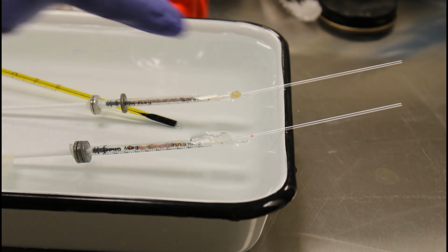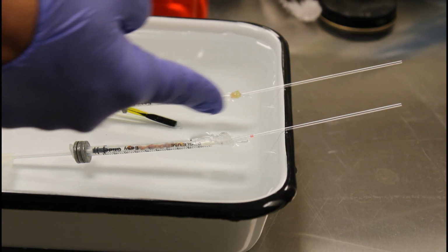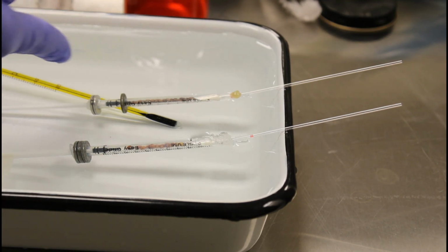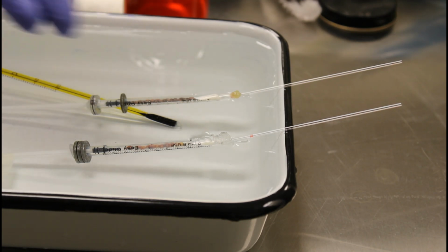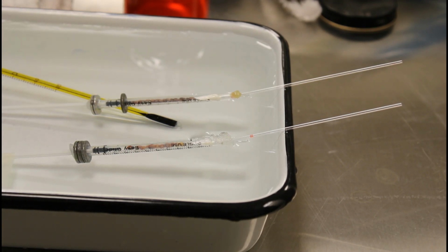I also want to point out that the micro respirometer on the right here has live seeds in it. So these guys are germinating, whereas the respirometer on the left has an equal volume of dead seeds. These have gone through the autoclave, and they should not be respiring because they're dead. So we're using this as a control. And if we do see changes in the volume of the gas inside this micro respirometer, we should probably use it to correct the changes that we see over here in our treatment, the micro respirometer that has the live seeds.